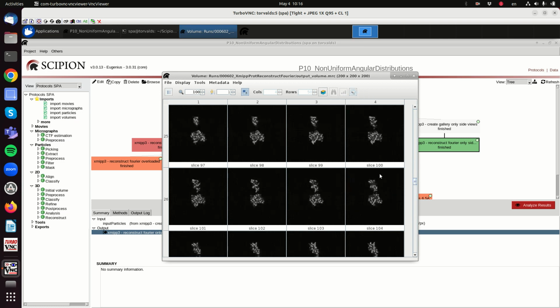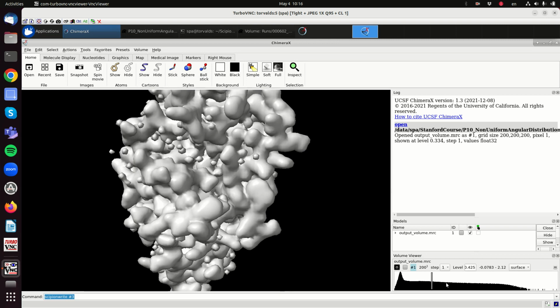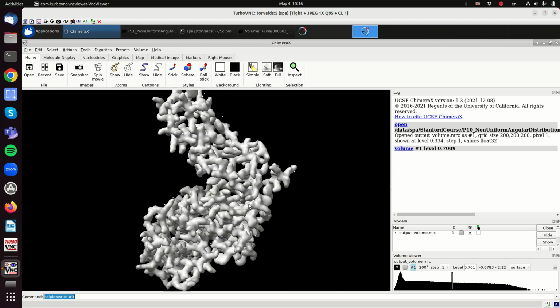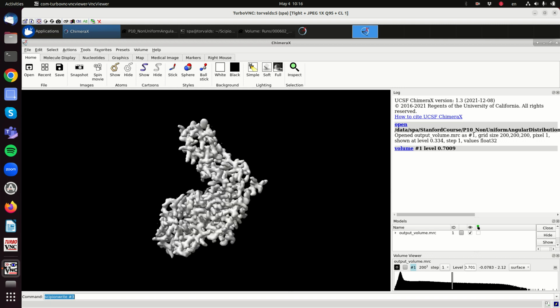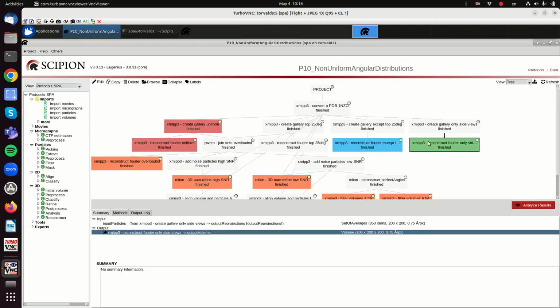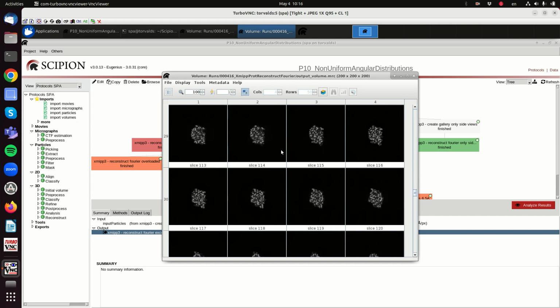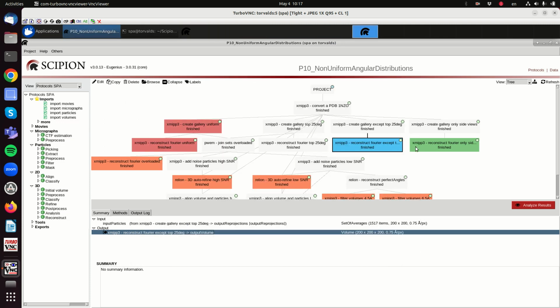We can see it in 3D again. If you think of this process in Fourier space, we have filled the full Fourier space, and we see the same as in the original PDB. The same happens here when we have all kinds of angles except the top 25 degrees. Again, in the reconstruction we don't see any artifact. And if you think of what we are doing with the central slice theorem in Fourier space, we are filling the full Fourier space, so we see the full structure.